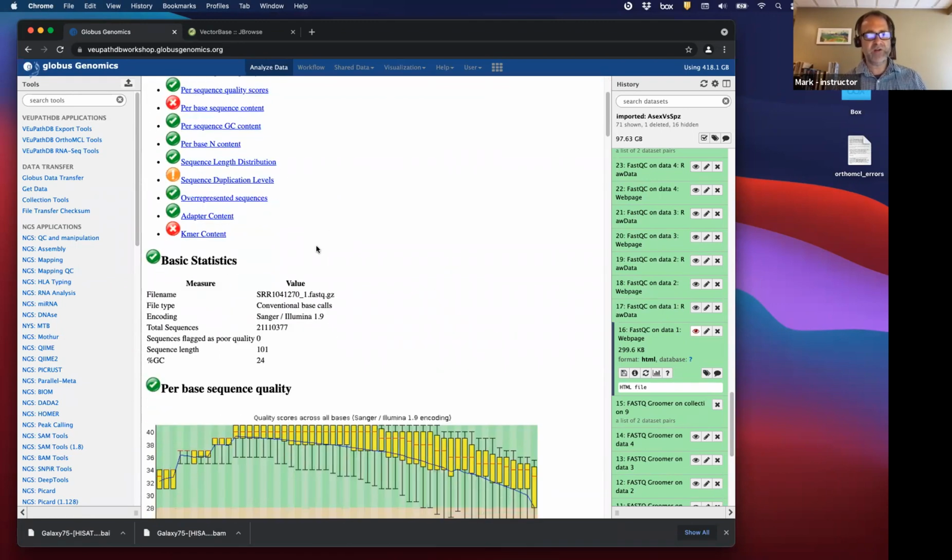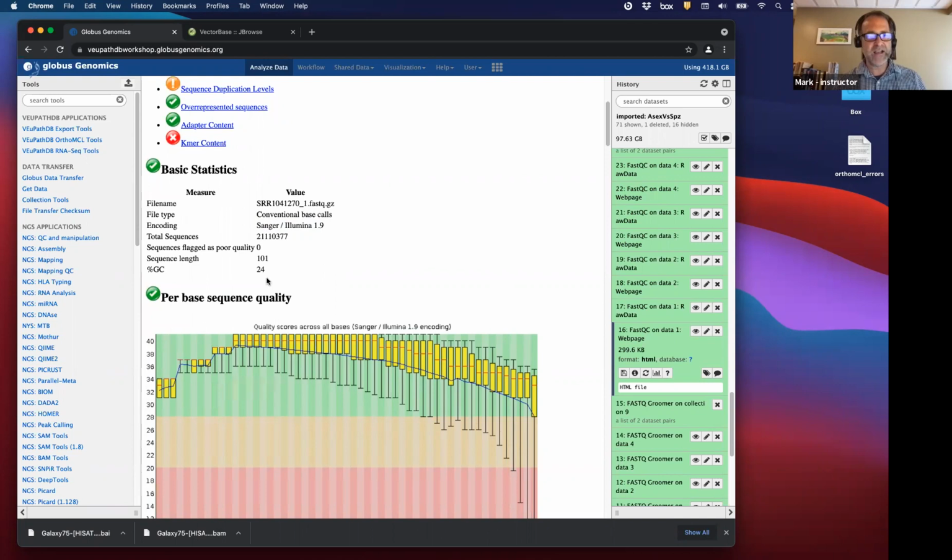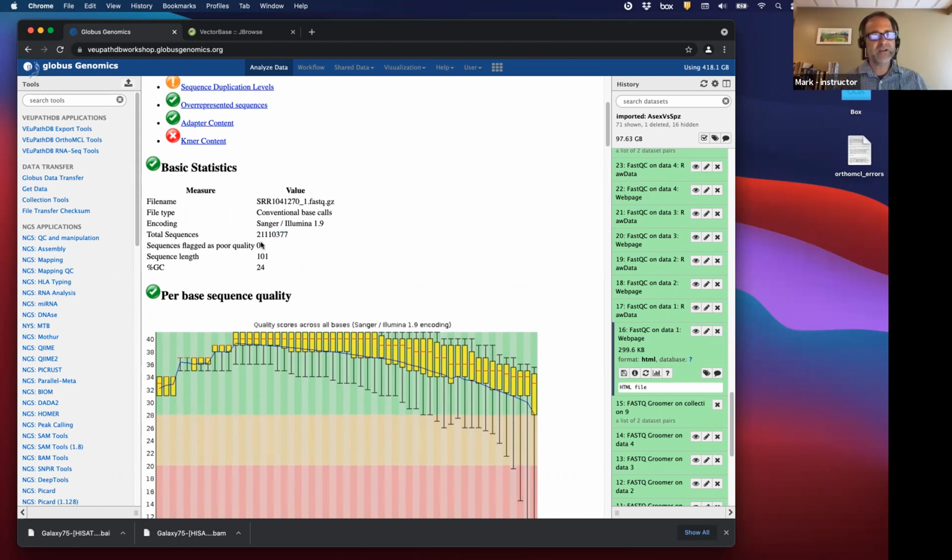So we're going to scroll down to the basic statistics: file name, file type, encoding. It actually figures out there are lots of different types of encoding for those quality scores. You remember those ASCII characters? There's a bunch of different versions, and it usually tries to guess which version it is, and it found that it was Sanger/Illumina 1.9. The total number of sequences, or the total number of reads that it identified, was, I heard, 21 million. So that's pretty good.